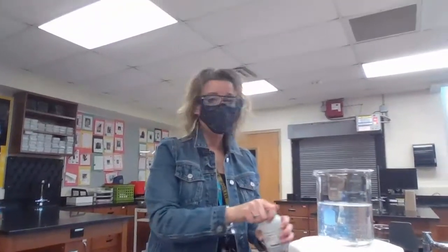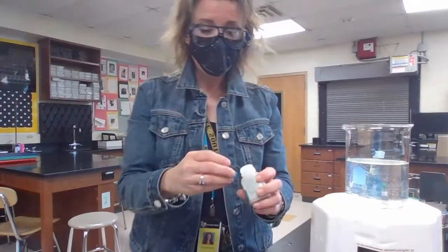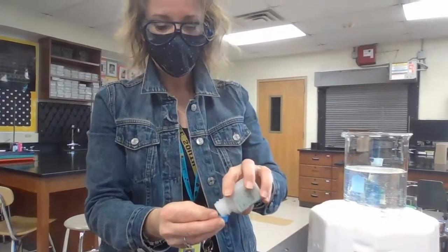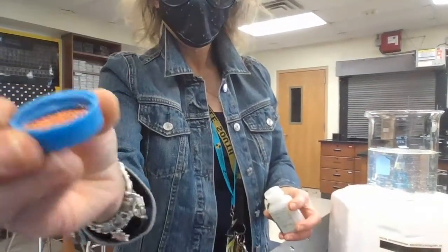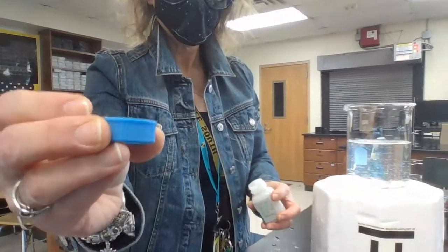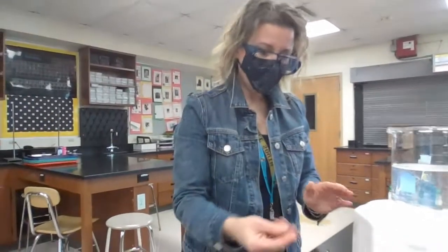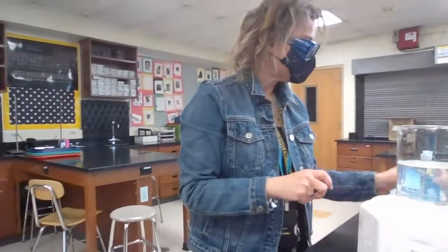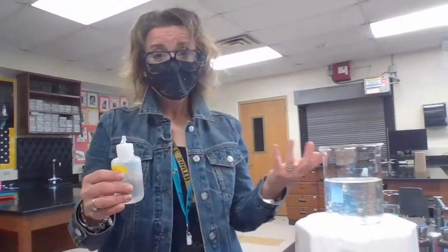So copper, as you know, makes up the outside of pennies. So that's why we put a penny on that sheet that you guys have. And, ooh, how do I do that? There you go. A lot of times people would tell me that kind of looks like shiny nail polish or whatever. Oh yeah, for sure. But it's definitely really pretty. So let's see what happens.